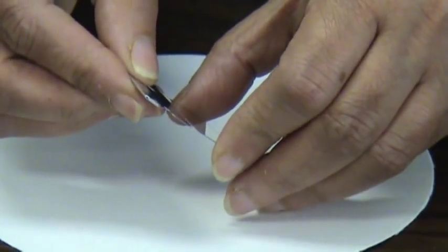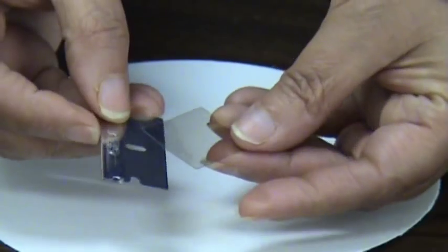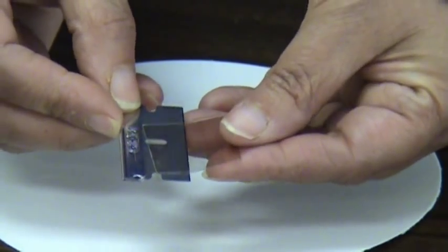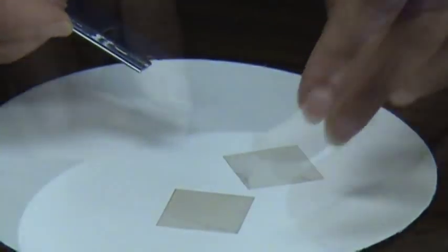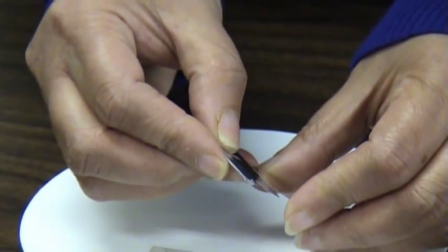Note that other than starting the separation of the mica planes, the sharp edge of the blade is really used more to slide through the piece and separate the pieces rather than doing any actual cutting.